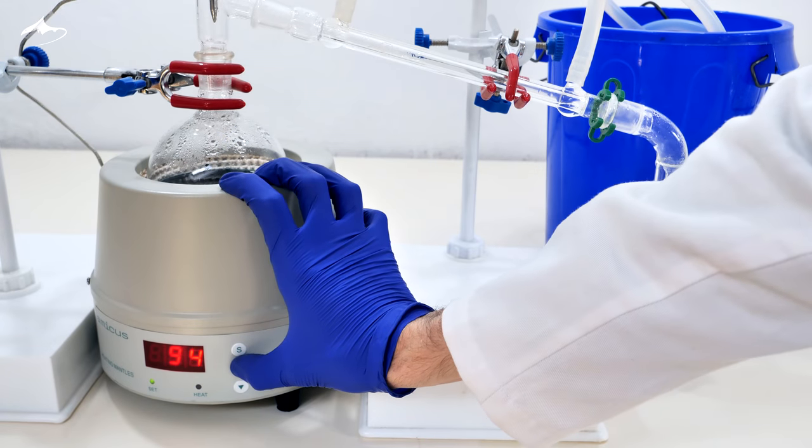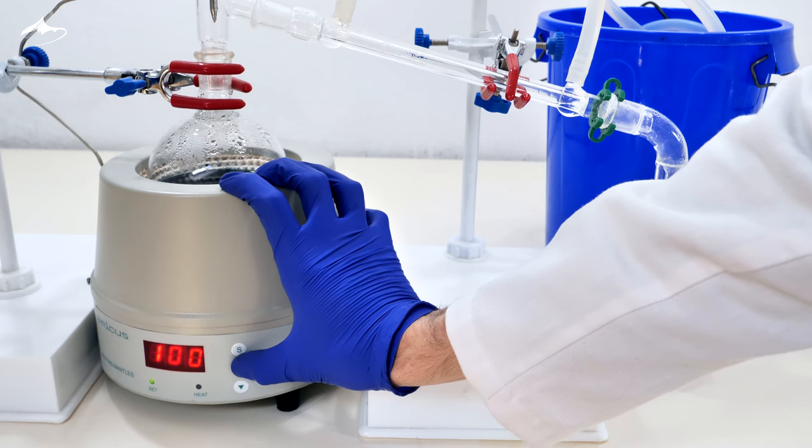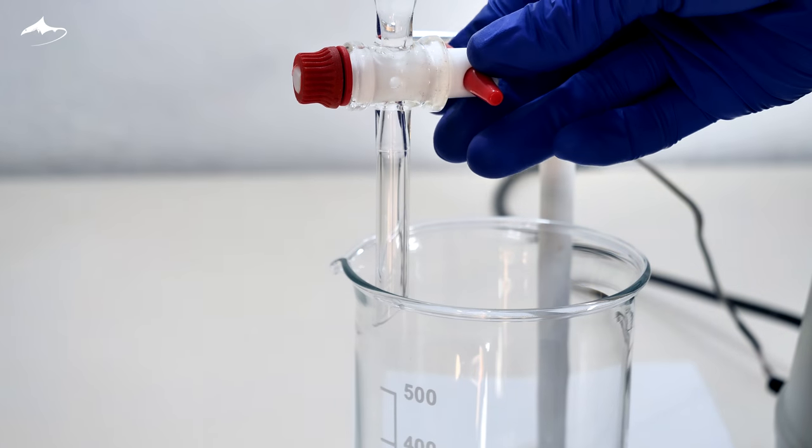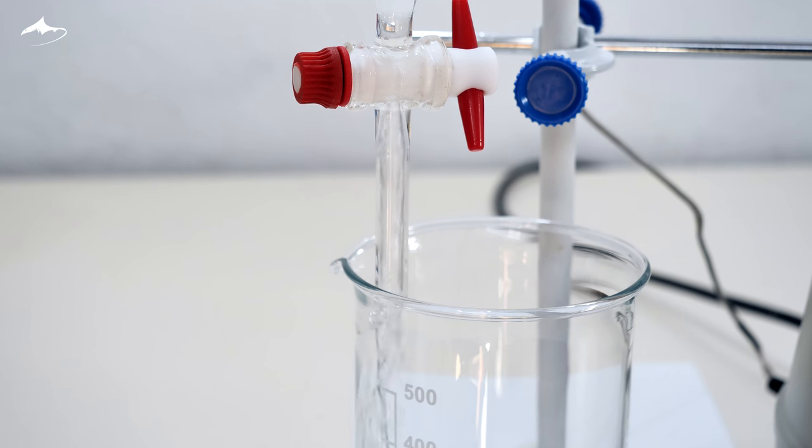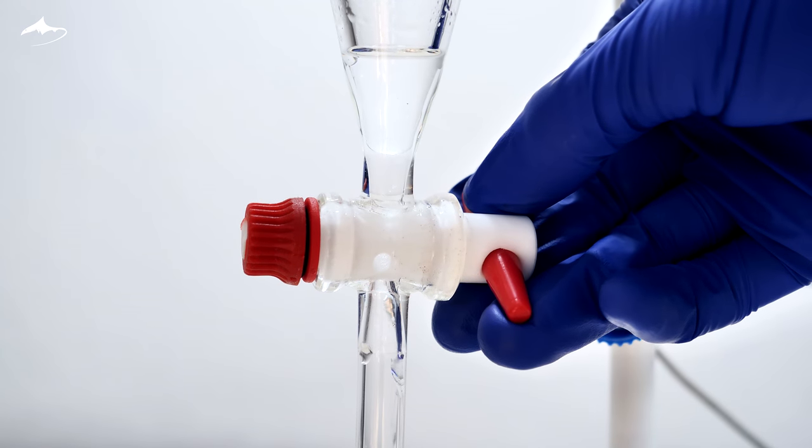In the meantime, I recovered a little more of the distillate, just in case. After letting the phases separate for a few minutes, the bottom aqueous phase is decanted, leaving a small volume of water in the funnel.